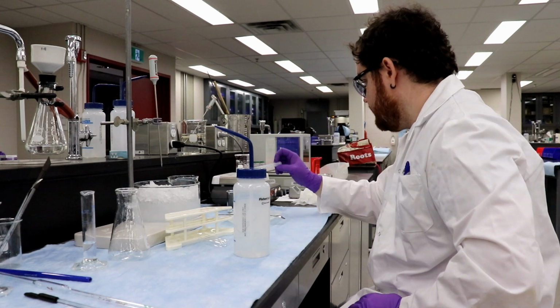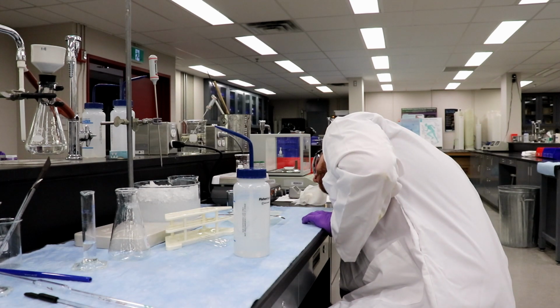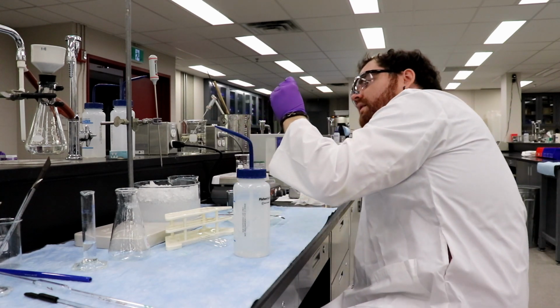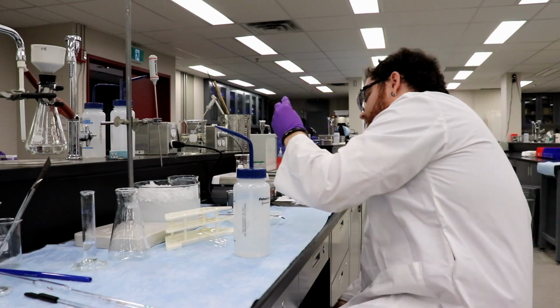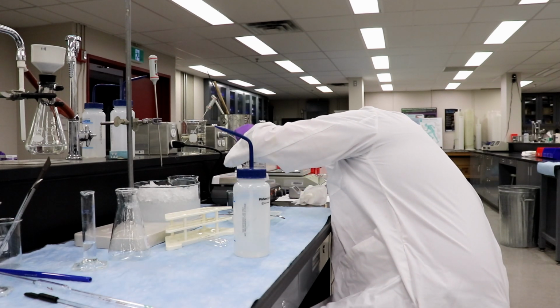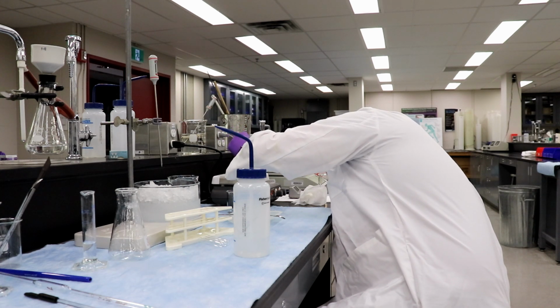Yeah, is there liquid on the surface that you can sort of just use? I can try. We'll see if it works. Just try a little bit. Is this clean? Yes, it was with water. Just see if it works. Oh, look at that. Ingrid the rock star. Well, I'm just going on the rule that we're supposed to minimize the amount of water. Yeah, if we used more water, we could just boil it off, but I do agree.